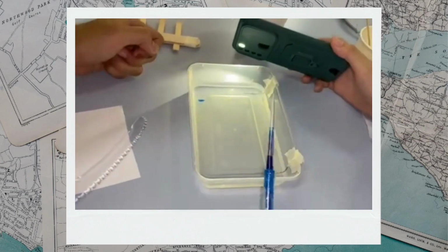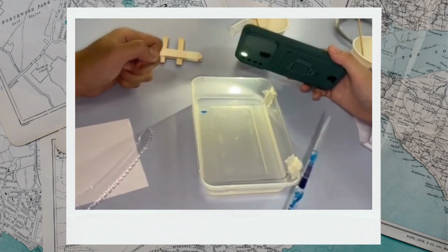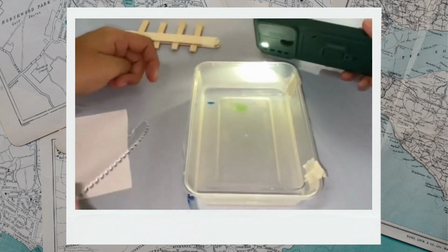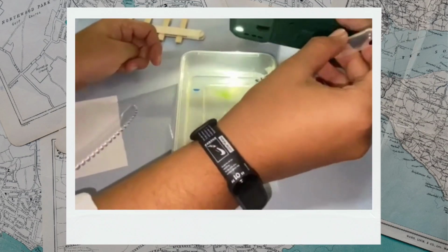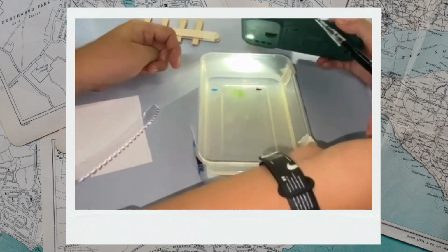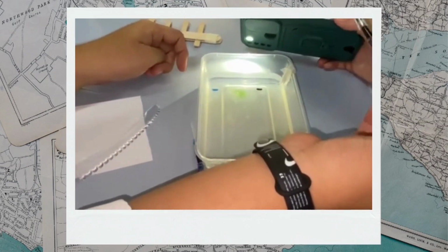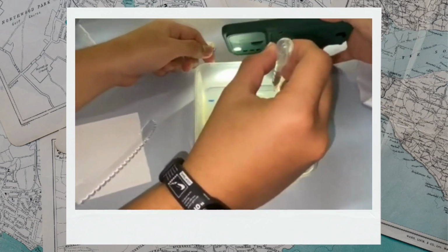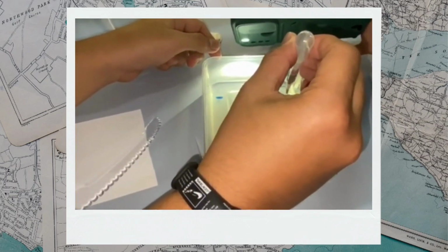Use the needle tip pipette to transfer approximately 10 microliters of each sample to an empty well. The volume of the thin tip of the pipette is about 10 microliters. Submerge the tip in the buffer directly above the well and gently squeeze the sample into the well. It should fall into the well since it is denser than the surrounding buffer.